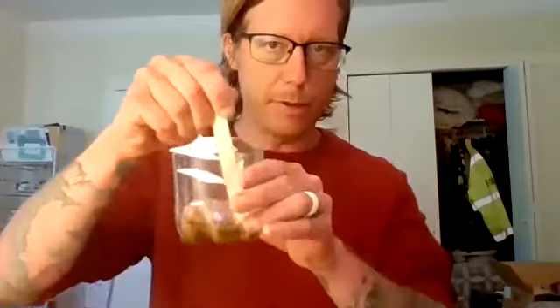We're at 2 grams. So the reason you got these cups is because it's far easier to mix something in something like this than it is to try to mix it in this bad boy. So we know our conditions are correct. We know our measurements are correct. So I'm going to put the manure in there, and I'm going to put my liquid in there. So now we know we got the correct ratio. This may actually take a minute. So sometimes I will just prep and label. Like if I have 5 samples to do, I might just prep and label them all at once, because really it takes a little while for the manure patty to break up in here. You can see I'm just mixing it up.